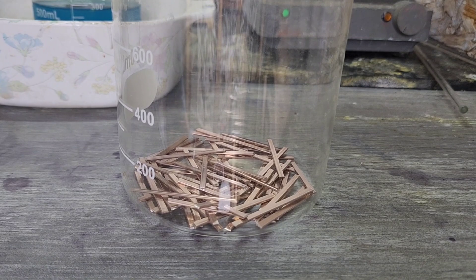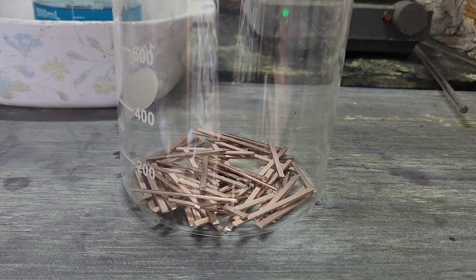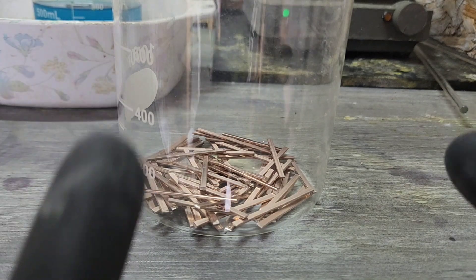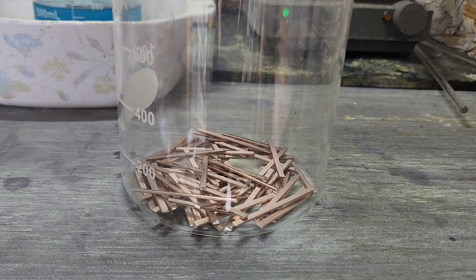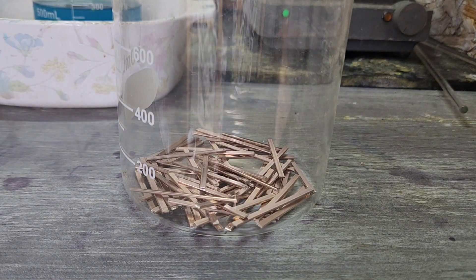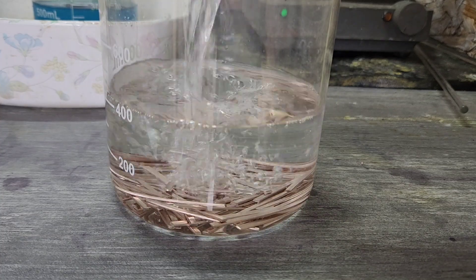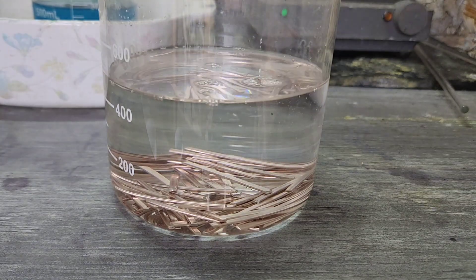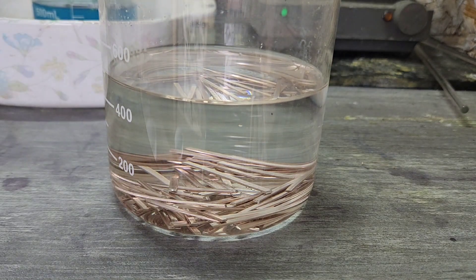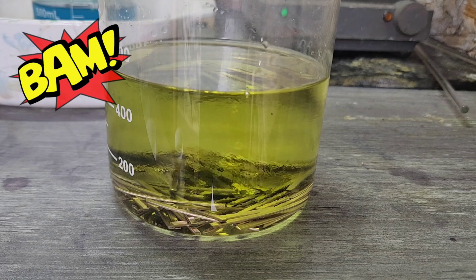It is time to tackle Tim's projects — he sent me some silver/alloy sticks. I want to show you the way I did it the first time, but the only difference now is I'm going to use 12% hydrogen peroxide versus the 3% I was using last time. So let's go ahead and start with some hydrochloric acid with just a little bit of hydrogen peroxide, and just like that — BAM — we made AP.